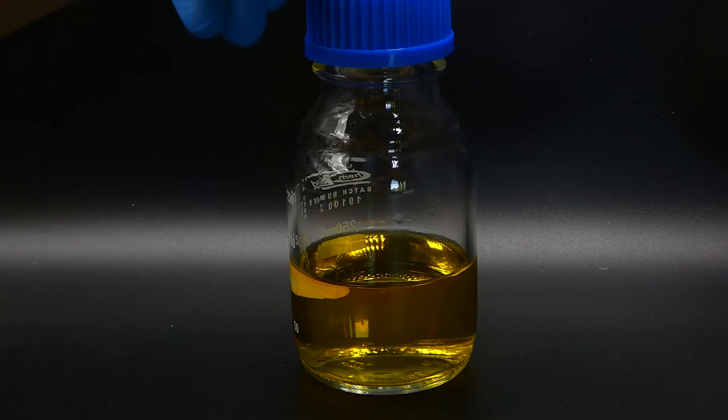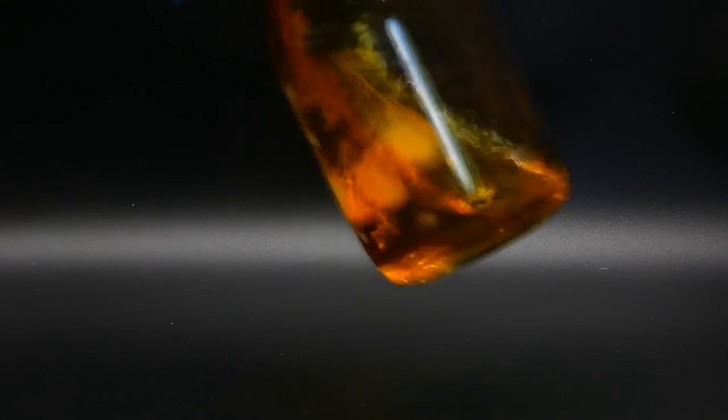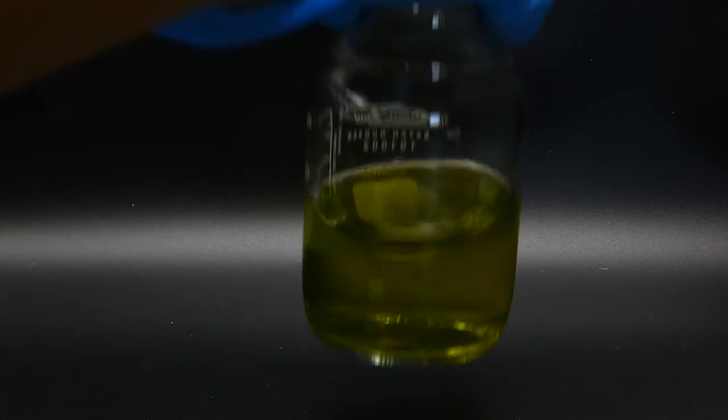The best part comes when you shake the mixture. If shaken gently, it turns from yellow to red, and if shaken more energetically, it becomes green. If it's allowed to rest, it slowly changes colors once again.